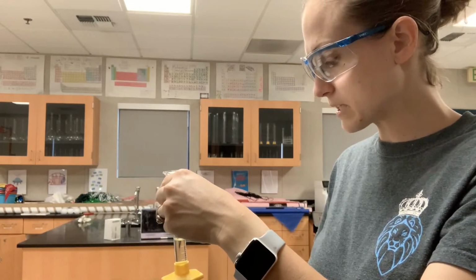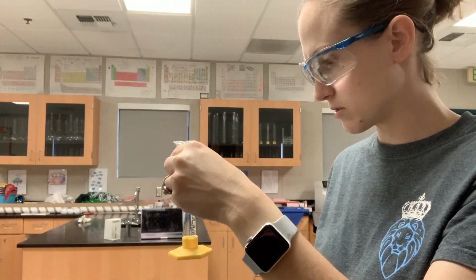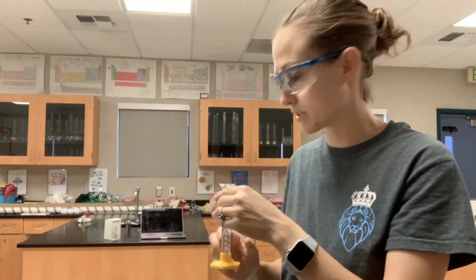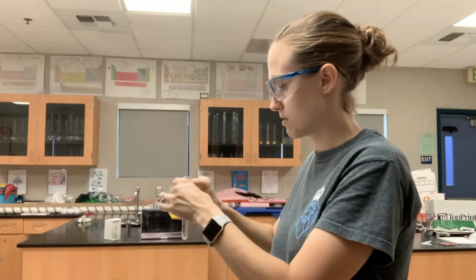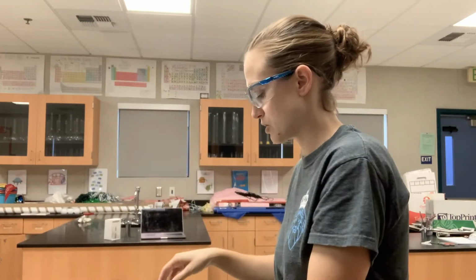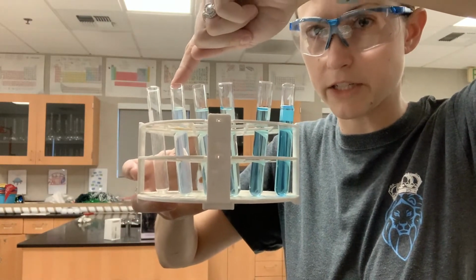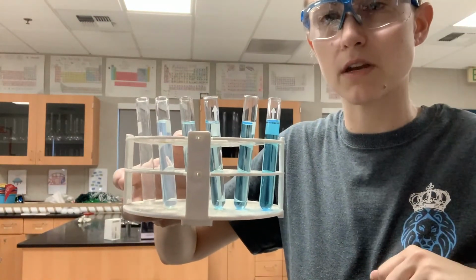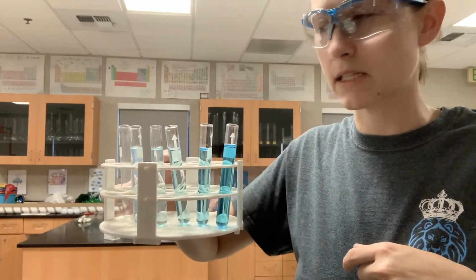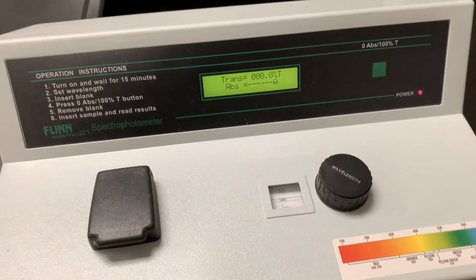All right, in order to use the spectrophotometer to determine the absorbance for all 5 of these solutions, what I'm going to first have to do, just like with the electric scale where I zero the scale, is zero my spectrophotometer. Before I do that, I wanted to quickly show you all of my solutions. You can see this is the most dilute solution that I just made. This is my 0.4 molar solution. You can see how they're increasing in concentration. I'm going to measure their absorbances, record them, and use the Beer's Law curve for that. So notice my spectrophotometer is ready to go.